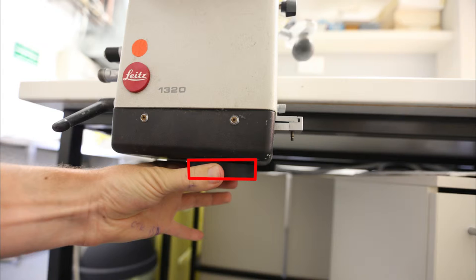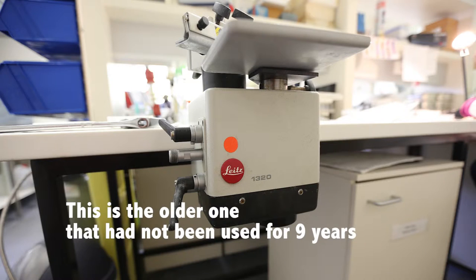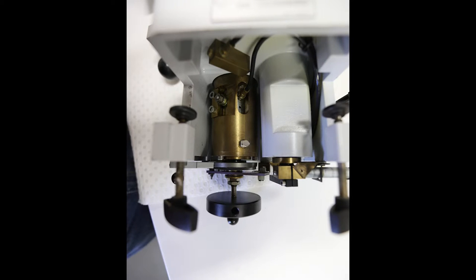When I found that I had that problem with the newer microtome, I took the older microtome out of its box and attached it to the table, and I found that it had exactly the same problem. When I put it in the box, it was working fine. Without having been used and just being stored the whole time, it seems to have come up with the same problem.